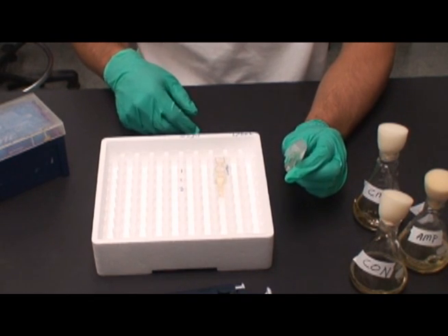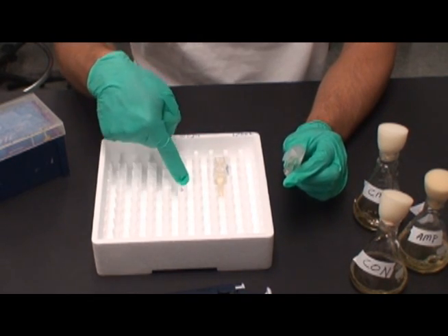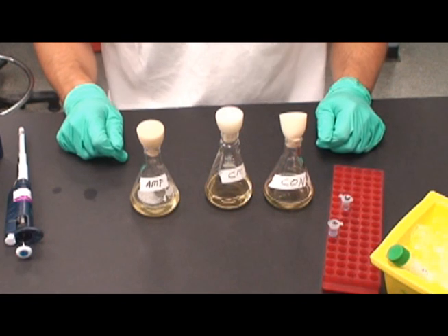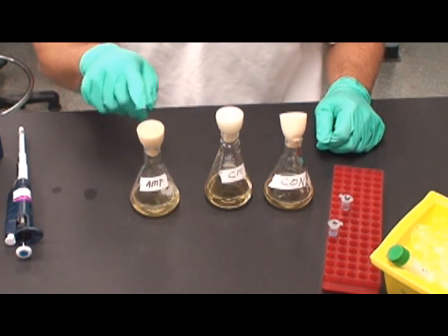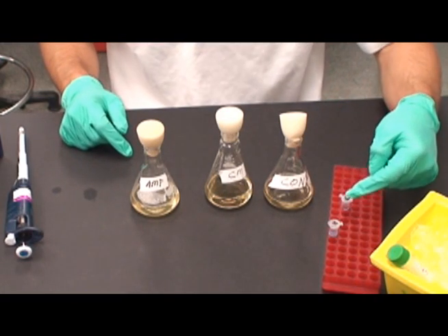At 40 minutes, remove the 3 flasks and take OD readings as done previously. Now it is time to inoculate the 3 flasks seen here with the antibiotics here.